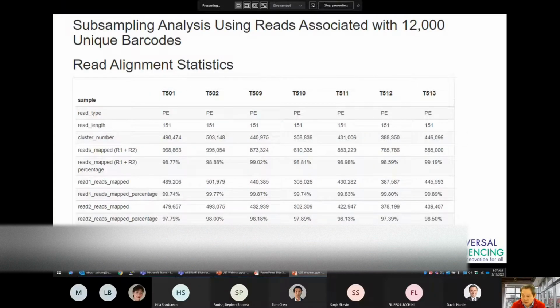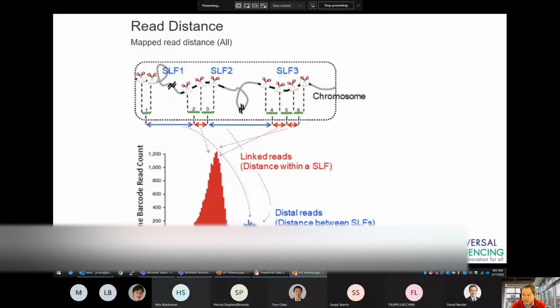The last part of the TellRead analysis characterizes the quality of the input DNA. This is done by selecting 12,000 barcodes for each sample and mapping their reads onto their respective references. This way, you can get a good indication of the percent reads mapped. In this table here, the percent reads mapped is at least 98%. The mapping of reads also allows us to understand the clustering of reads on the genome.